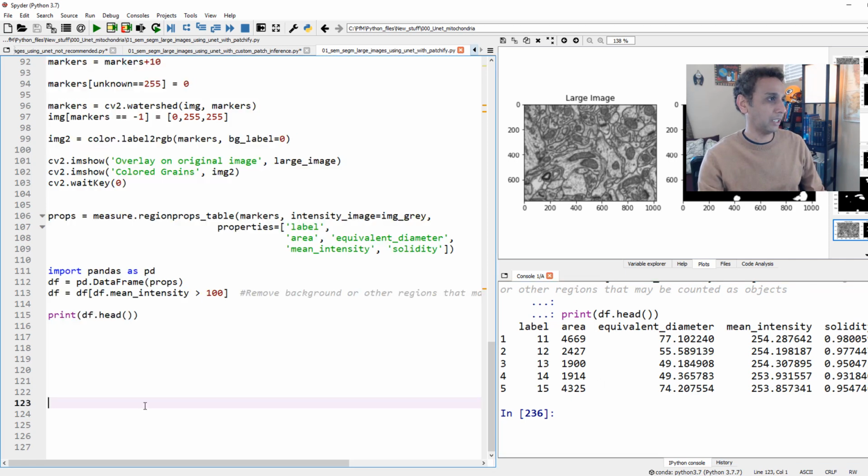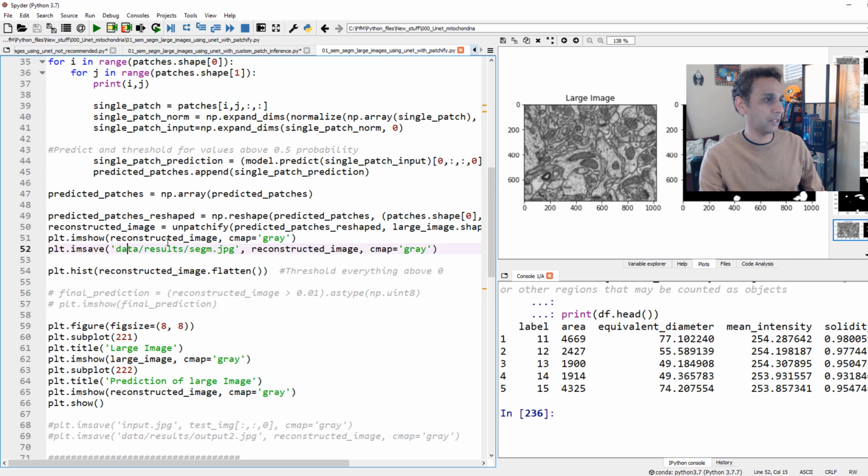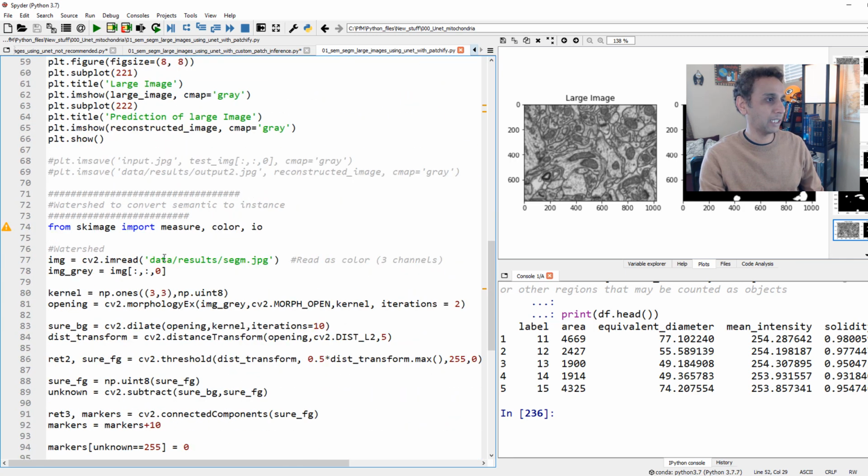At least let me confirm that that's not the case. We are saving the result here as data results segm.jpg, and we are reading the same data results segm. When I see identical results, I get a bit worried because there's got to be some statistical deviation, but in this case, I don't see a reason why it should happen. Okay, so I hope you found this video to be useful. At least you learned 2 ways not to do semantic segmentation on large images.